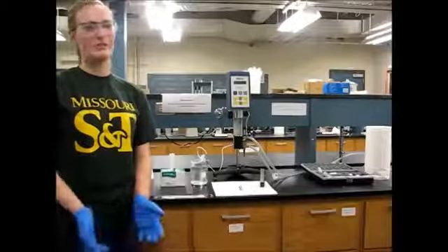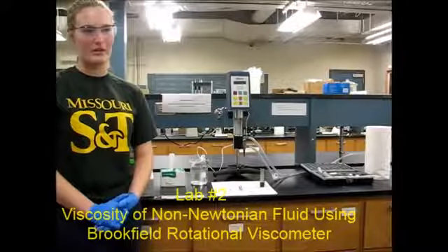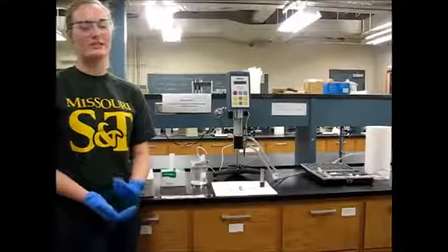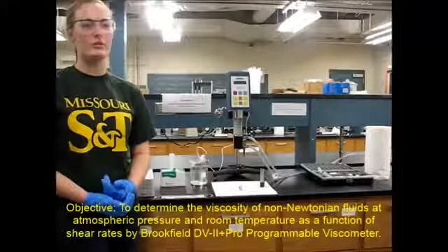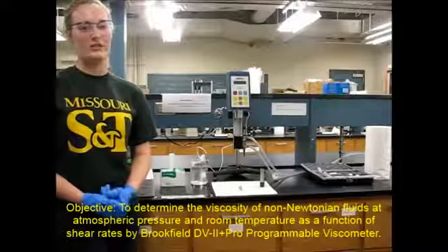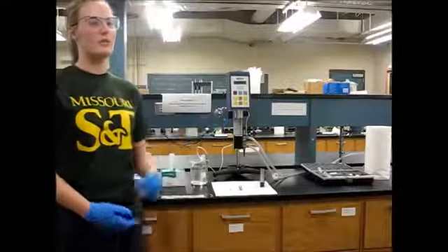Welcome to Lab 2, Viscosity of Non-Newtonian Fluid using the Brookfield Rotational Viscometer. As we know, fluid viscosity is defined as the internal resistance to fluid flow. The objective of Lab 2 is to determine the viscosity of a non-Newtonian fluid at atmospheric pressure and room temperature as a function of shear rates using the Brookfield Programmable Viscometer.